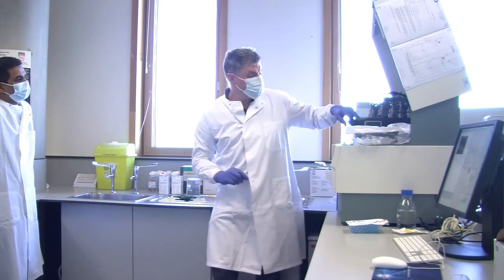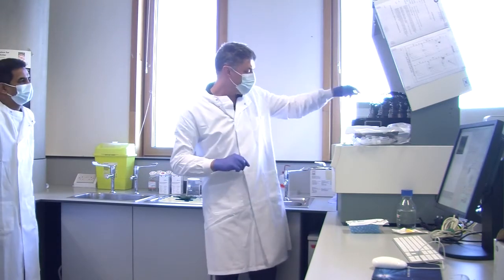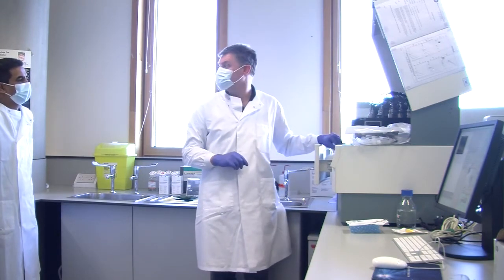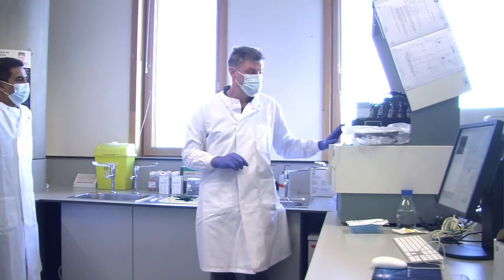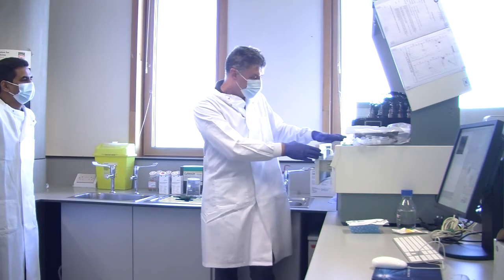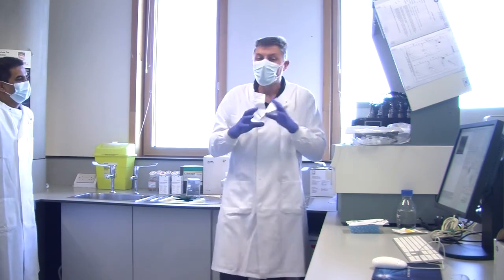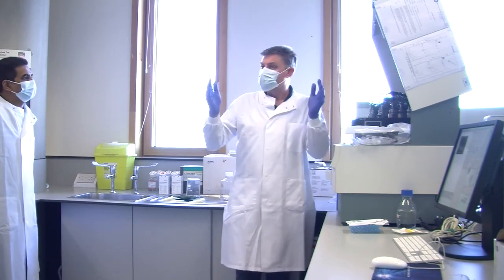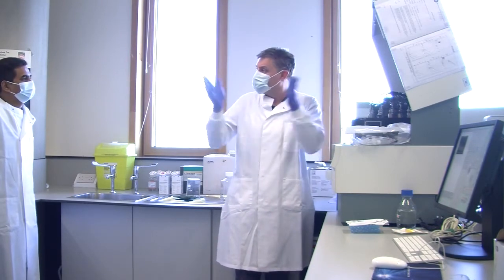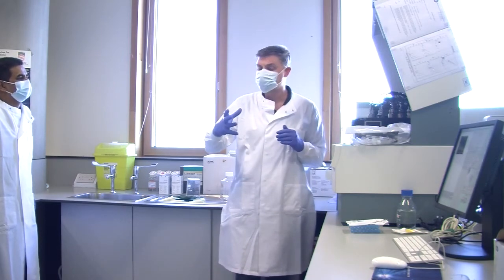And they end up coming through the flow cell here, and they come out this tube, and they go into a waste tank in here. All of this electronics, all of this fluidics in the drawer, and there's fluidics in here, and there's pumps, and there's valves, and so on, all of that is designed to get the cells into a single stream so you can hit them with a laser and measure their fluorescence and other properties.